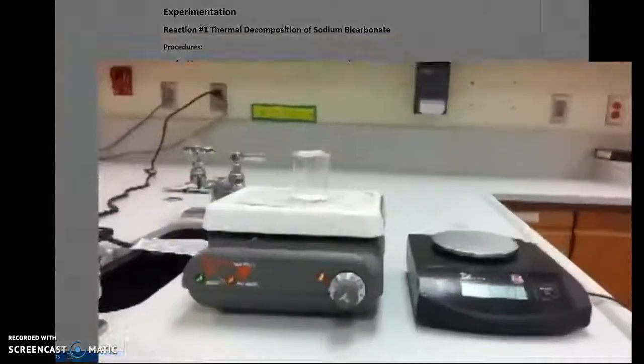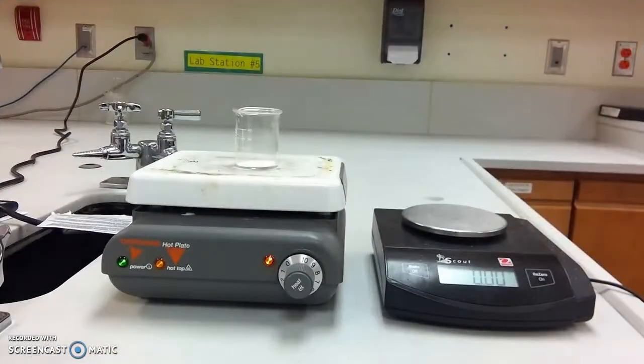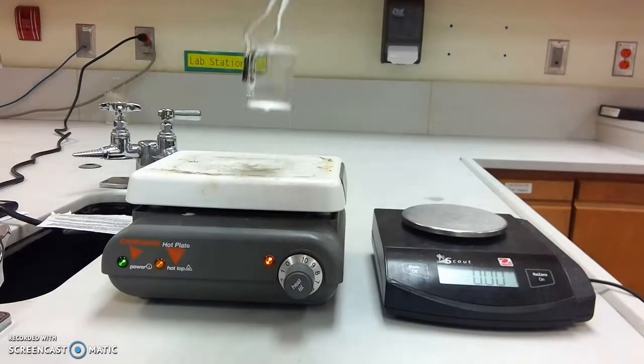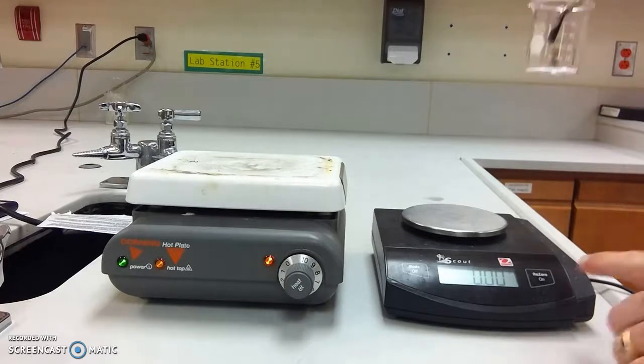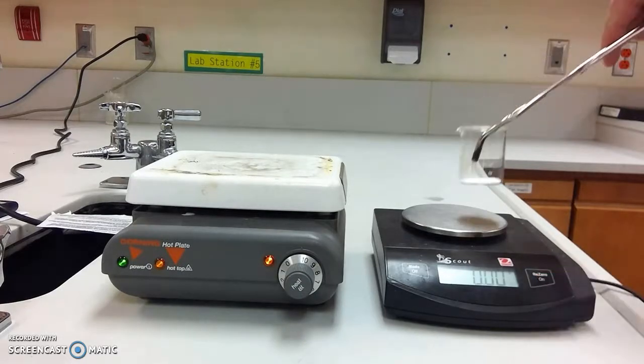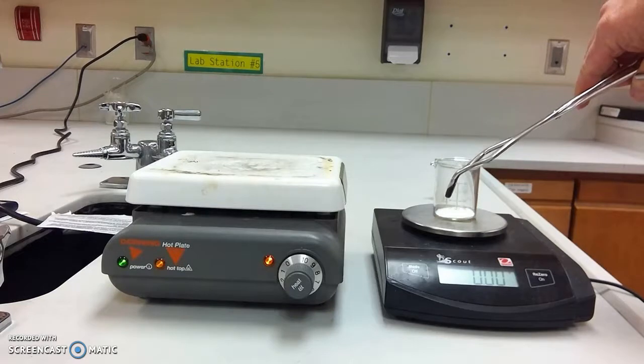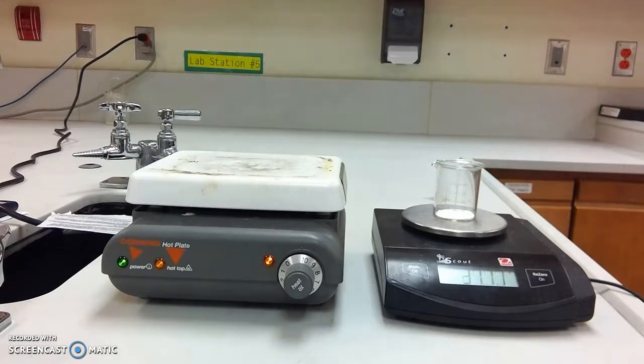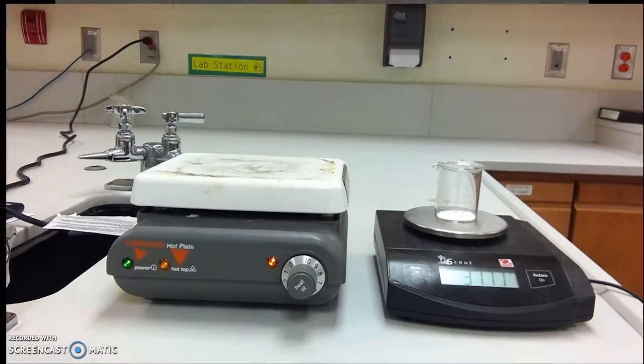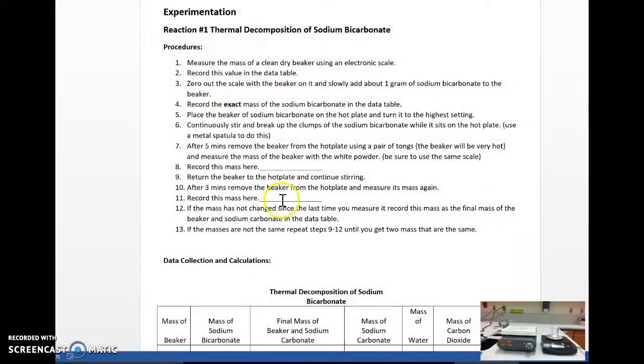Okay, so it's been three minutes. I've been stirring. It's broken up. The more the reaction is taking place, I'm going to again zero out my balance and measure the mass of the powder and the glass again. I will record that in this space provided on the lab right here.